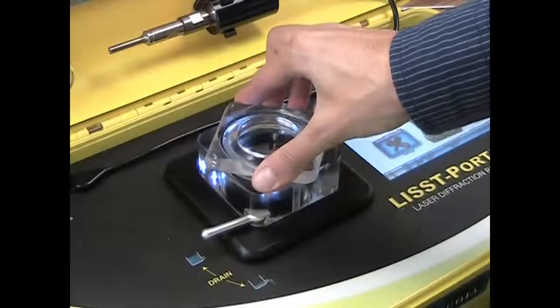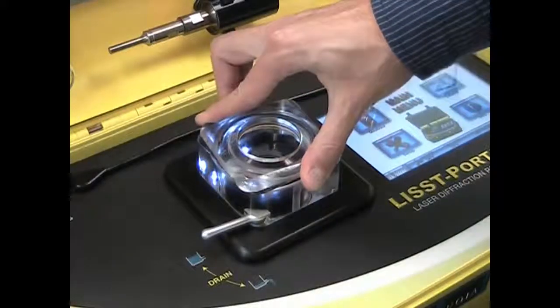Now replace the top cover of the sample chamber, then install the holder for the ultrasonic probe.